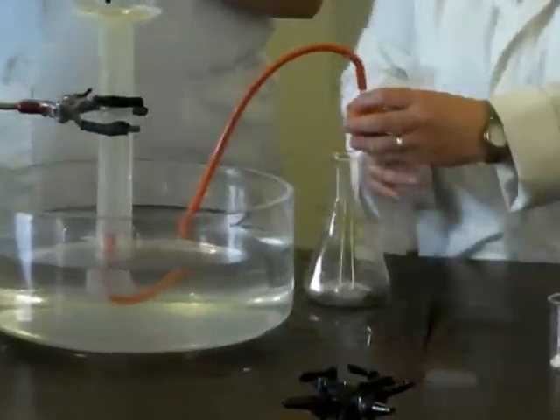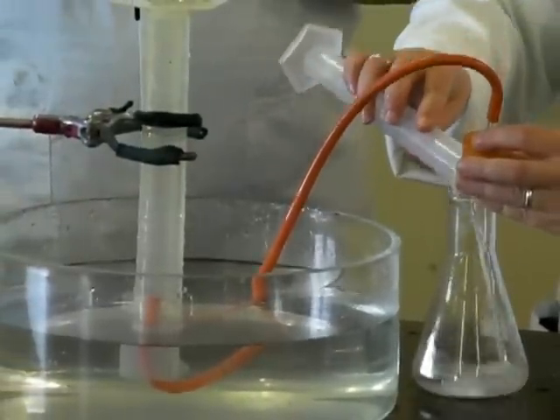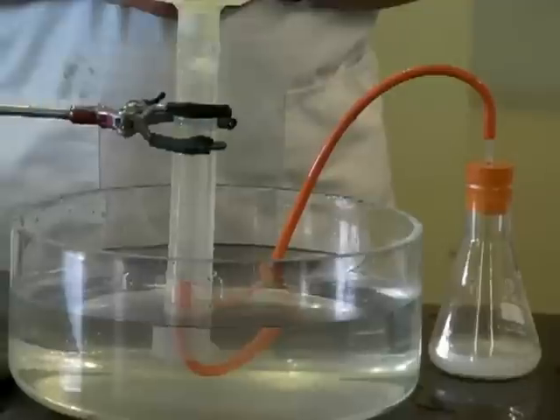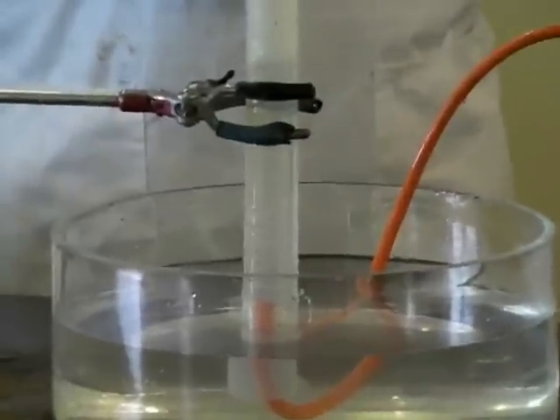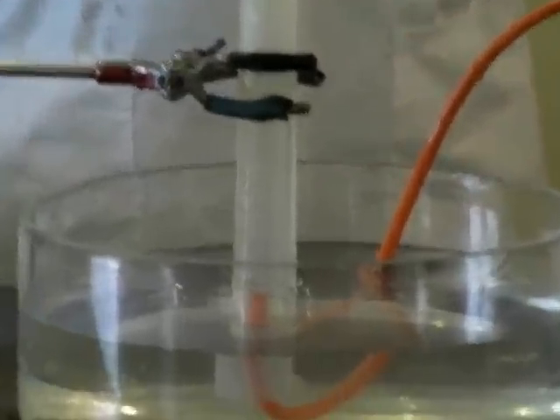You ready? Count me down again? You ready? 3, 2, 1. Again, we're getting the carbon dioxide from the marble chips and the acid. Seems a little bit slower. It's a little bit slower.